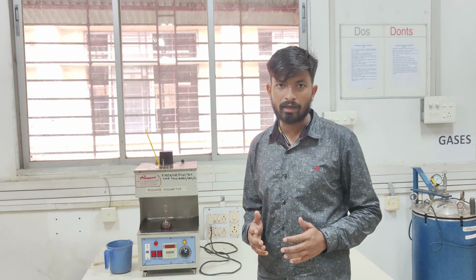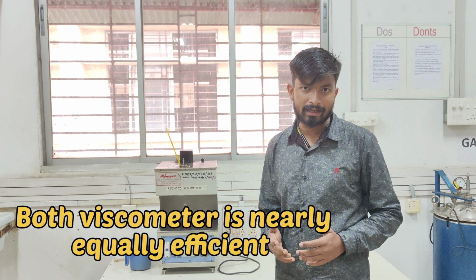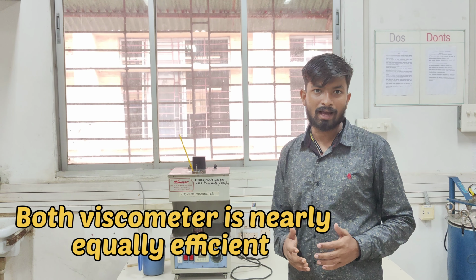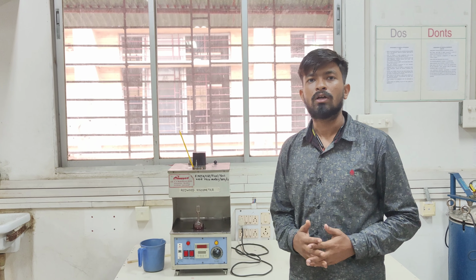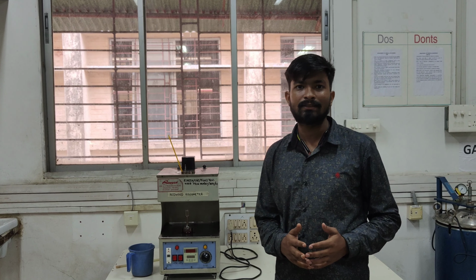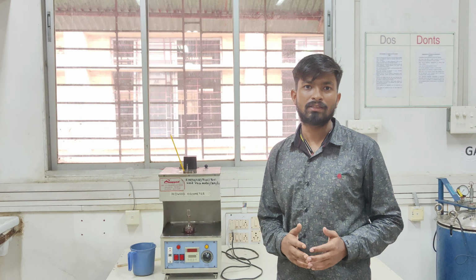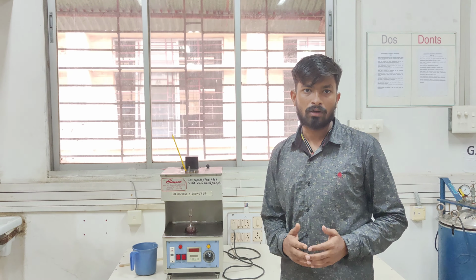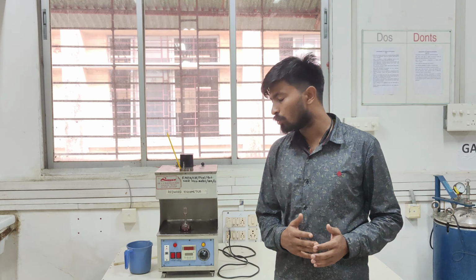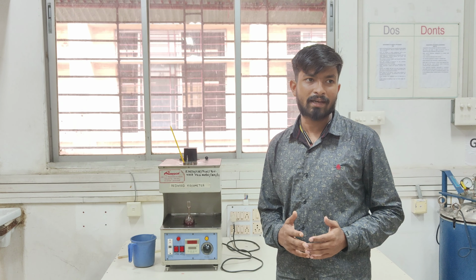Second, we concluded that the Redwood viscometer is more efficient than the Engler's viscometer, as in the Redwood viscometer the flow of the oil is dropwise, while in the Engler's it is a continuous flow, which shows that Redwood is more efficient than Engler's.